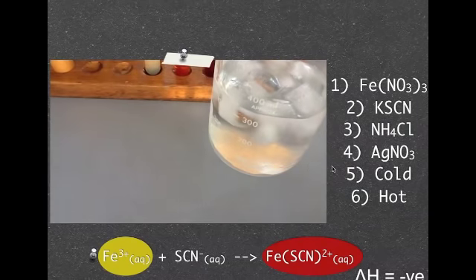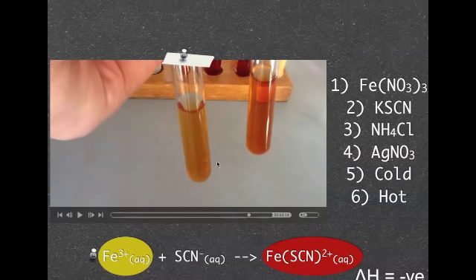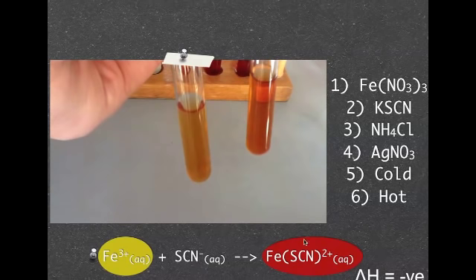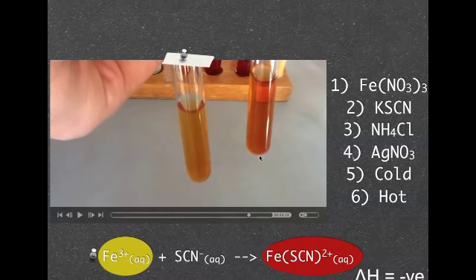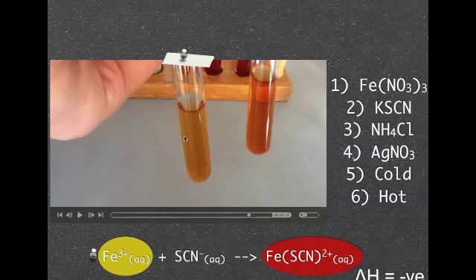So in terms of our cold water, which we're going to show you here now, it's become a bit more red. Because we made it cold, the equilibrium wanted to shift into a warmer direction, which is our exothermic direction. So therefore we've got a forward reaction happening there. Our one that we placed in hot water over here, the equilibrium, as Le Chatelier said, wanted to oppose it, so it wants to go in the cold direction, which is the endothermic direction, which is our reverse reaction.